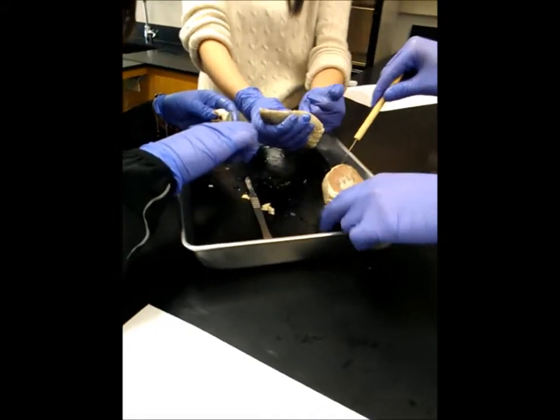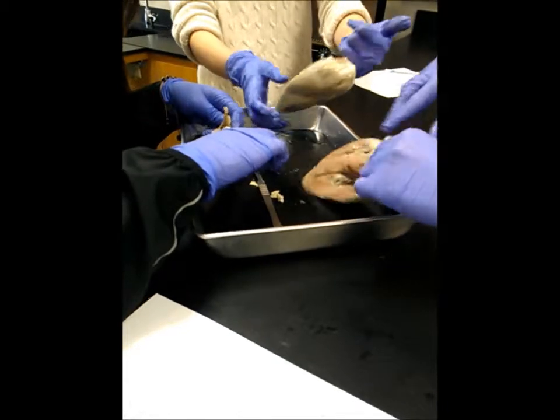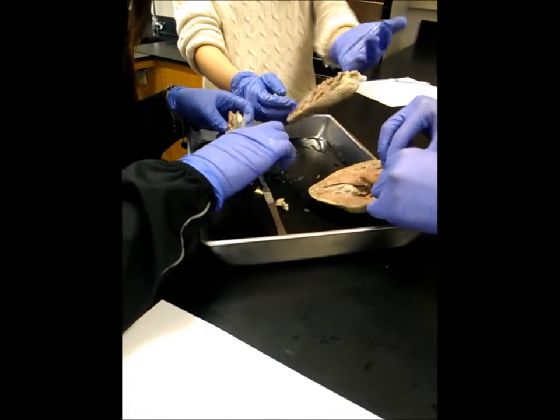Cut up the bar now. Oh, it comes over here. Look. Ew. What did you put your finger in? I don't know.